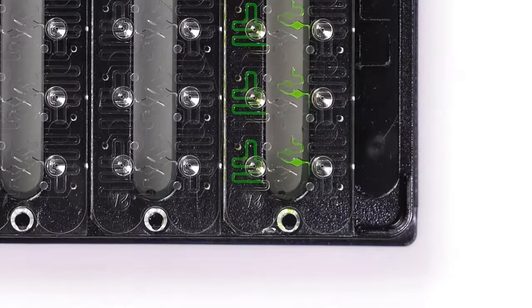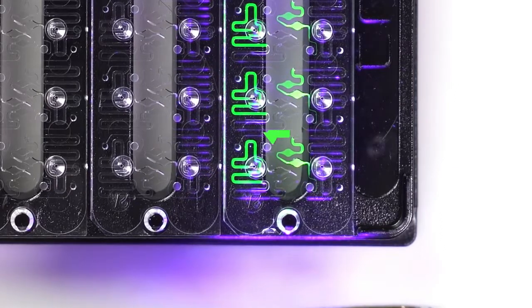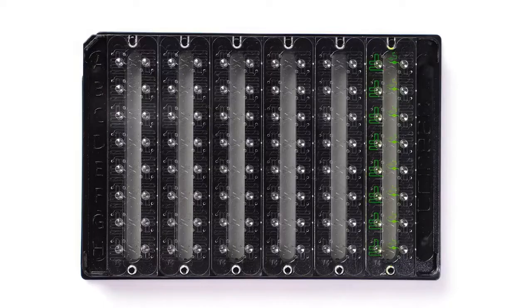If I light up that fluorescein with a black light, the unread column has all the fluorescein sample present in the serpentine part of the microfluidic circuit. The previously read column has the fluorescein in the microcuvette chambers where both UV-Vis and DLS data is gathered. Let's take the plate back over to Stunner where we can set up our experiment.